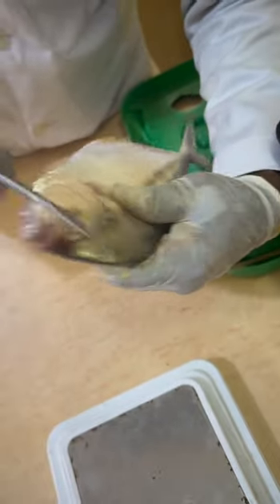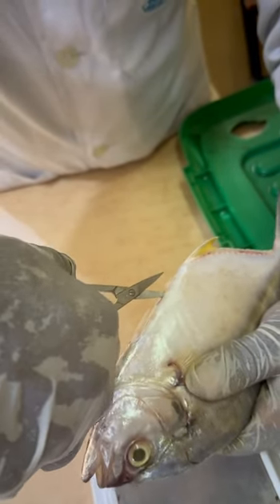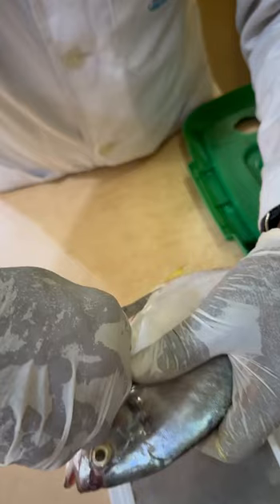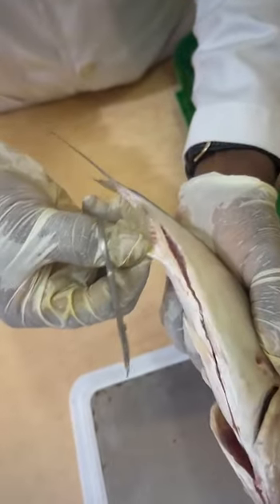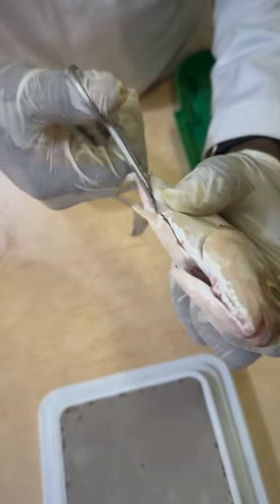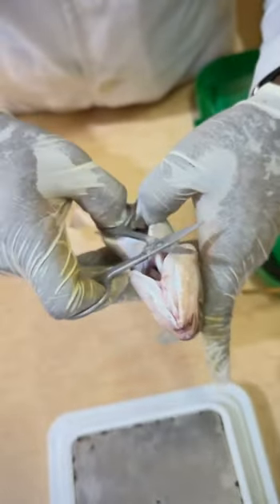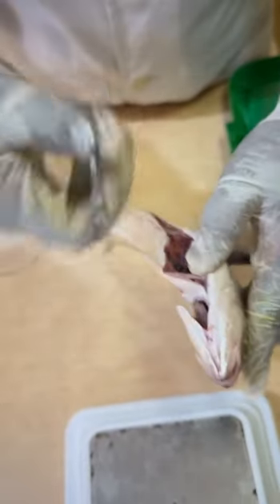The same way, when you want to determine the food and feeding in fish, especially when you want to check for the stomach content. Because of the nature of this fish, some other fishes don't have this kind of thing that will be disturbing. So what we'll do is that once we have done this, we'll open up the fish.